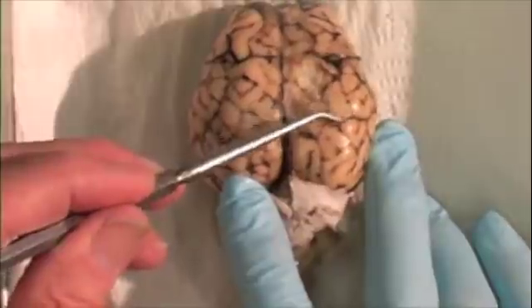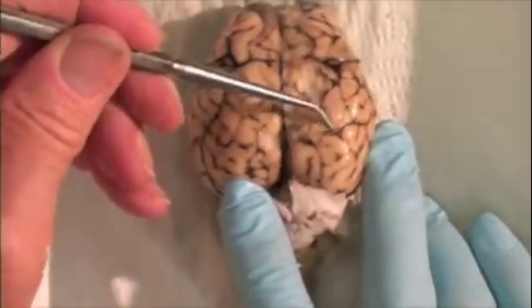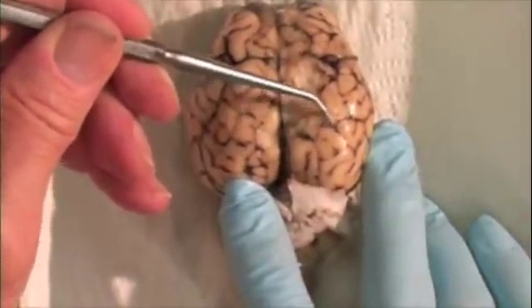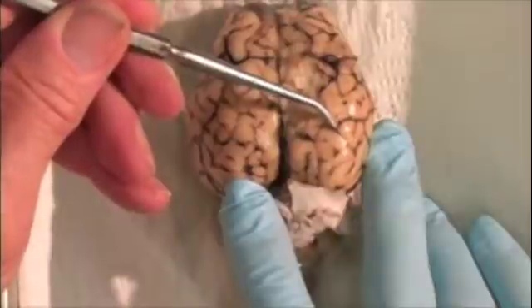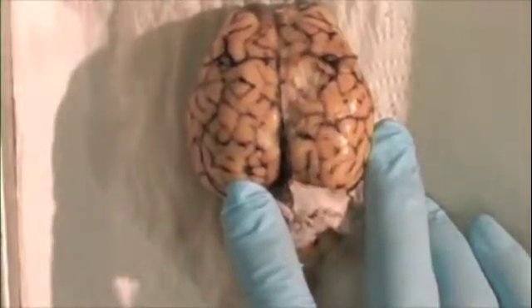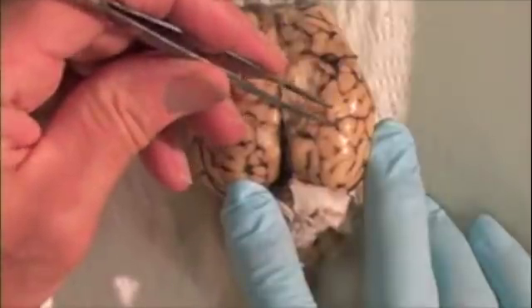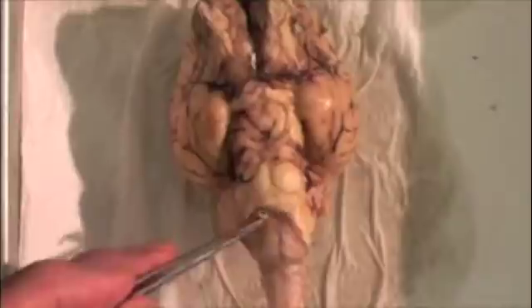The second layer is the arachnoid. It looks like a thin, smooth covering of plastic wrap over the brain. Here, some of the arachnoid has been peeled away from the underside of the brain.